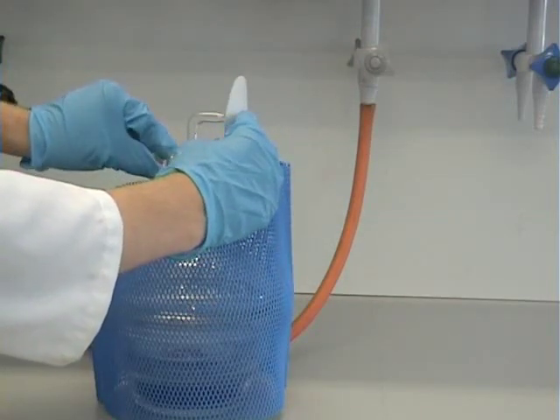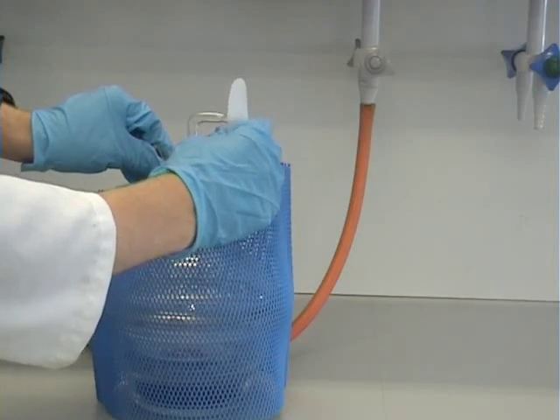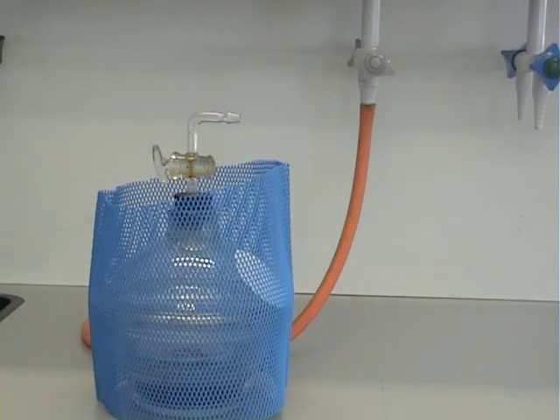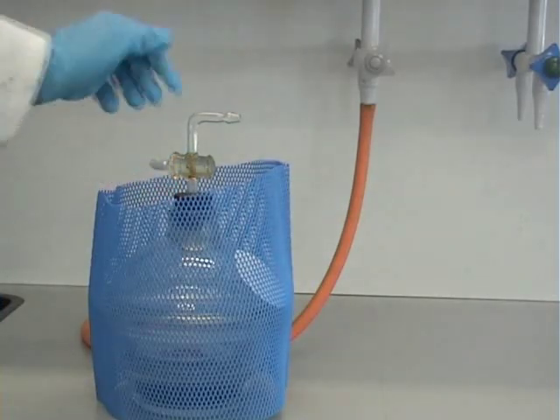To open the desiccator, place a piece of filter paper against the top and slowly open the desiccator tap. The filter paper should stick, and then when the pressures have equalized, it should fall off. Open the desiccator tap all the way to ensure there is no more vacuum left inside.